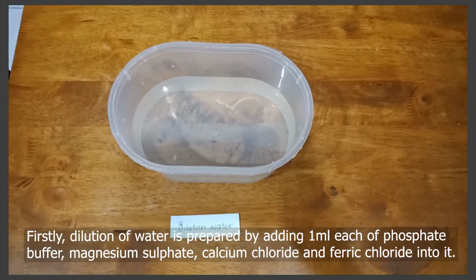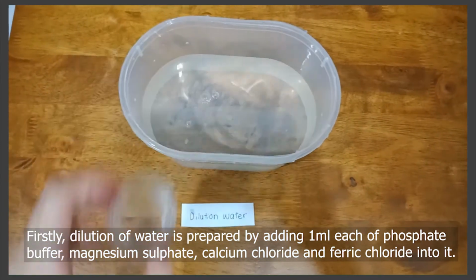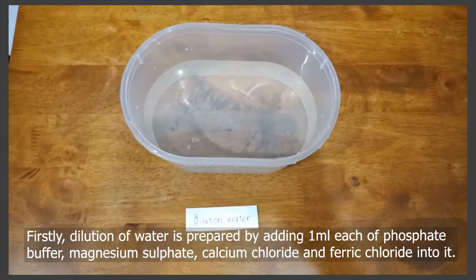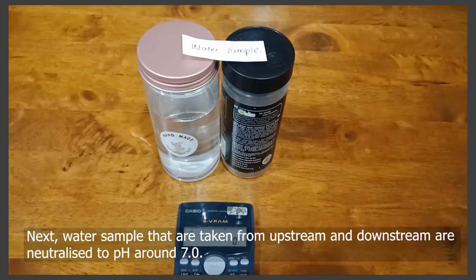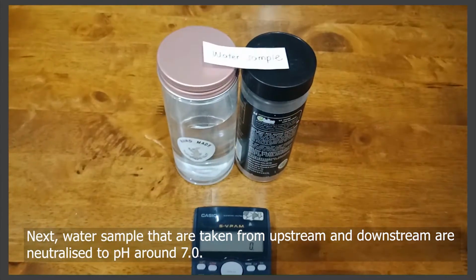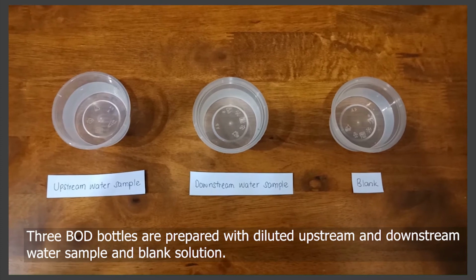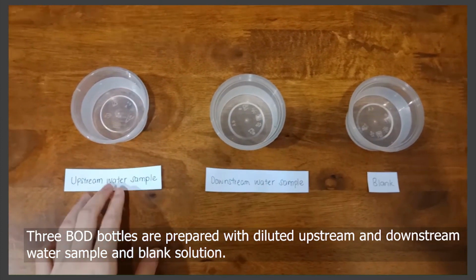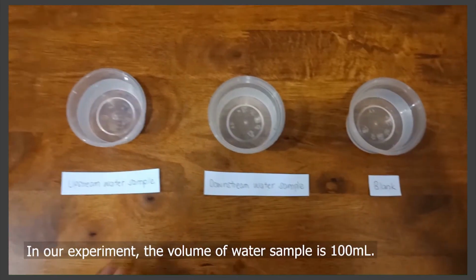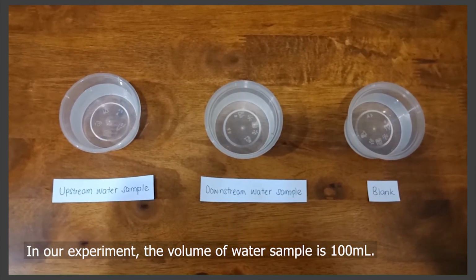Firstly, dilution water is prepared by adding 1 ml each of phosphate buffer, magnesium sulfate, calcium chloride, and ferric chloride into it. Next, water samples taken from upstream and downstream are neutralized to a pH of around 7. Three BOD bottles are prepared with diluted upstream and downstream water samples and a blank solution. In our experiment, the volume of the water sample is 100 ml.